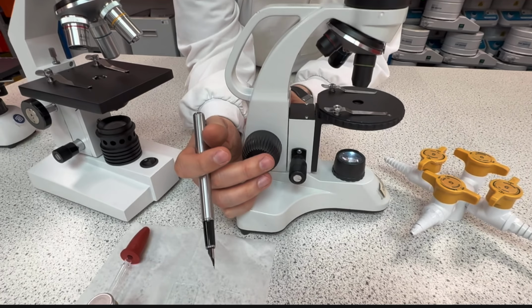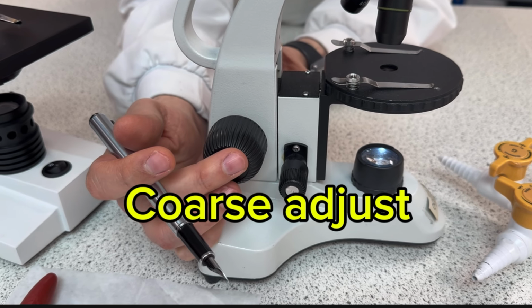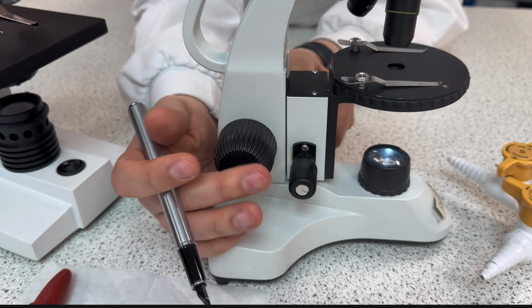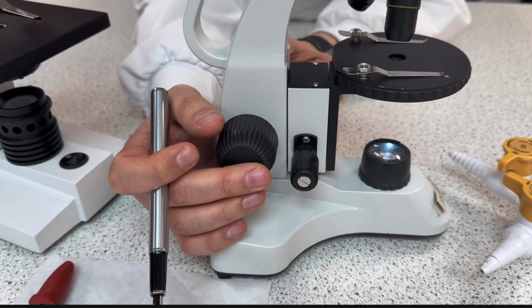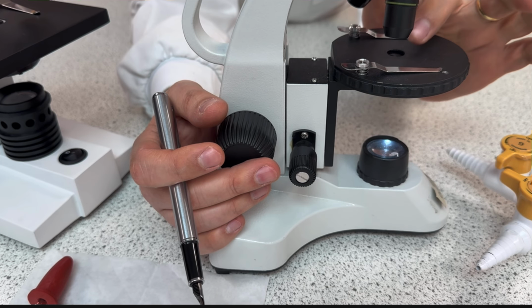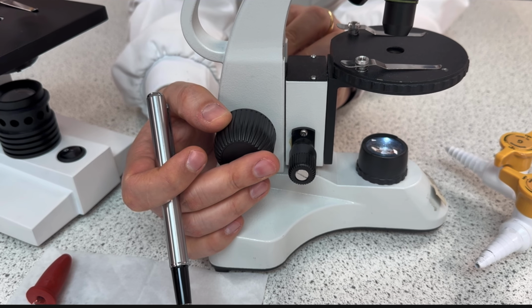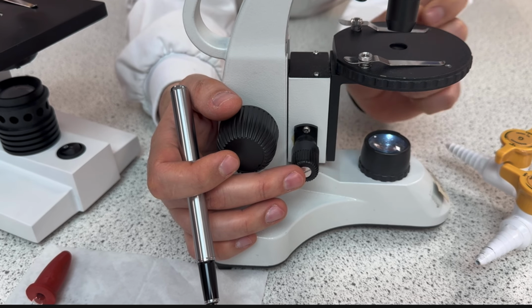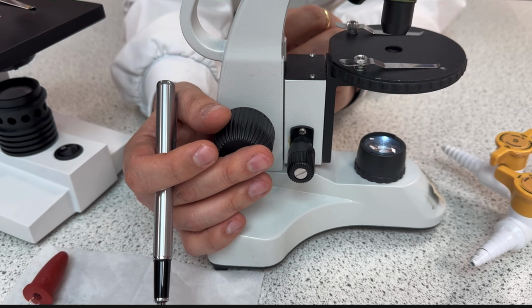I also have the coarse adjustment. That's the adjustment that makes the stage go up and down. And this is called the fine adjustment. So the coarse is for big distances. So when I need to focus the objective I'm seeing here, I start with this coarse. And when I'm almost seeing clearly, I go for the fine, okay? So the fine is a small adjustment. The coarse is for big adjustments, okay?